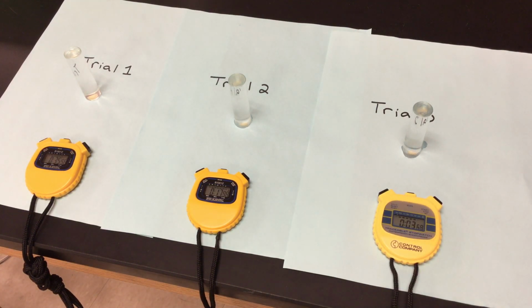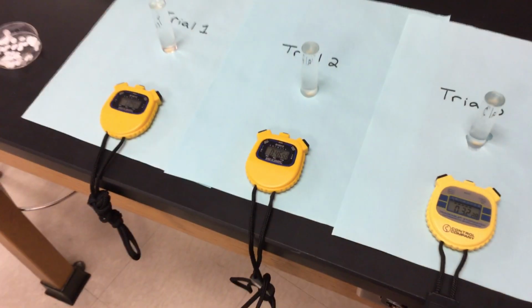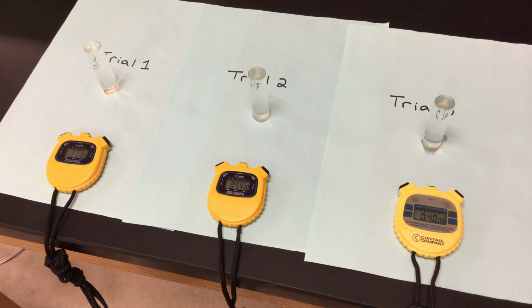Now we are at a pH of 5. It's just slightly acidic. Will this have any effect on our enzyme catalase that we have within the yeast that's on our filter paper disc? So we're looking to see if we have any type of bubbles that are forming. Let's see if I can get you guys a little closer here. So there's my little reaction going on. So there's a little bit of bubbling going on there with all of them with this pH of 5. But we want to get enough bubbles that it will trap on that particular filter paper disc and it will actually start moving upward. And when it starts moving, or if it does move, I'll let you guys know.